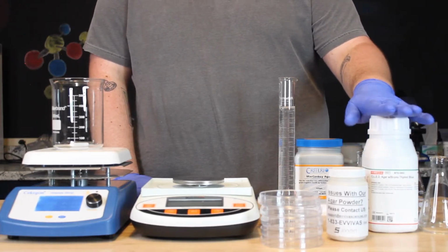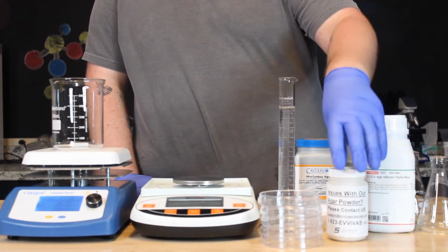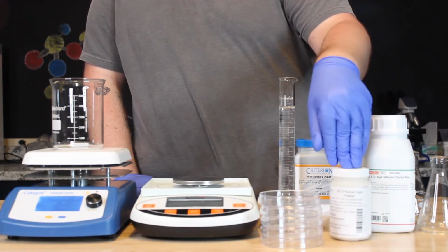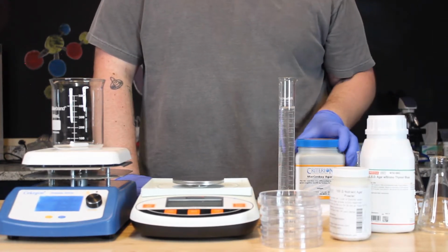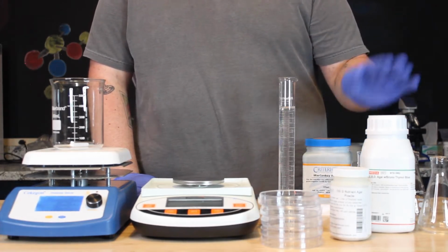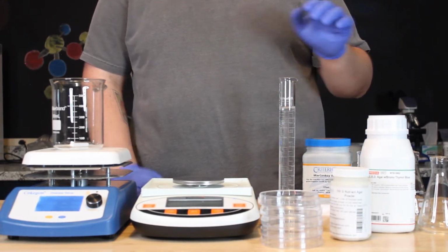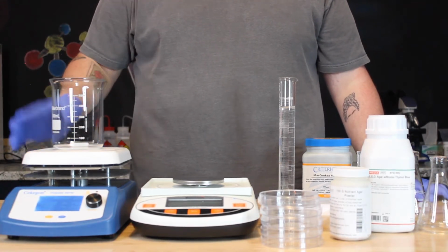Growth media is used in microbiology to grow microorganisms that require nutrients to synthesize four critical macromolecules: proteins, carbohydrates, lipids, and nucleic acids. We will be using three different powdered growth medias and water to create selective and differential media to obtain pure cultures of specific bacteria.